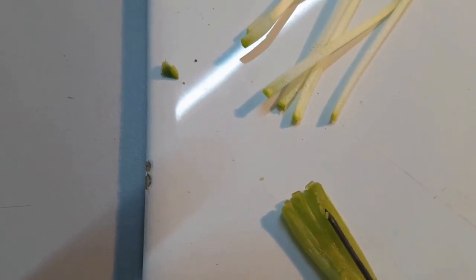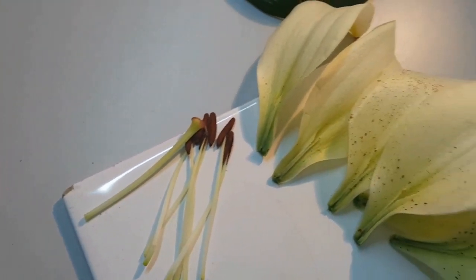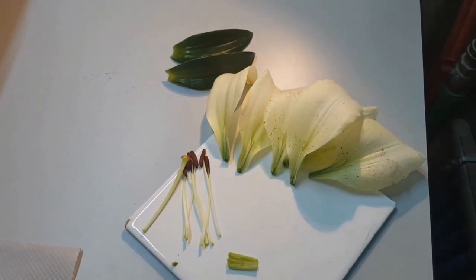So we've had a very successful plant dissection. After the petals were removed, we separated the anthers and the filaments off. Overall, they're known as the stamen, and that is the male reproductive organ. And then we dissected the carpel, which was the female reproductive organ. Here you can see the bits that were dissected.